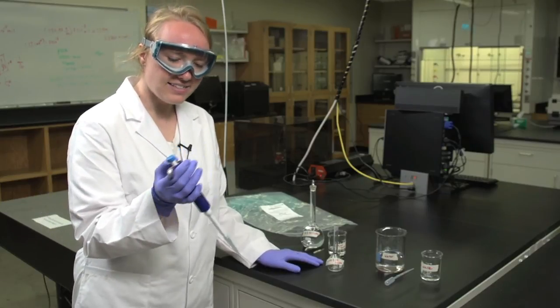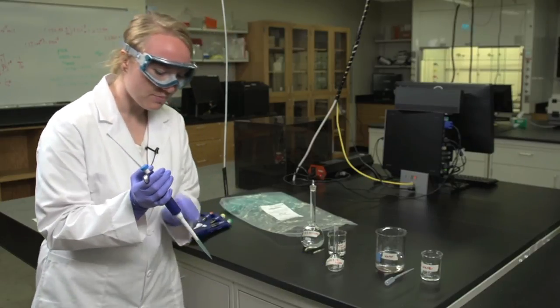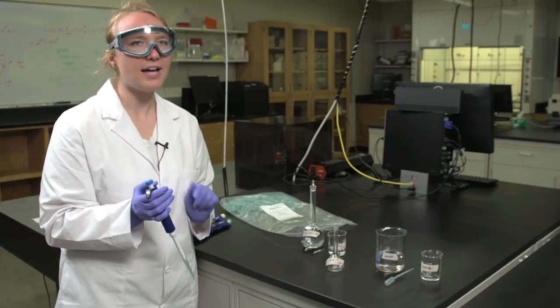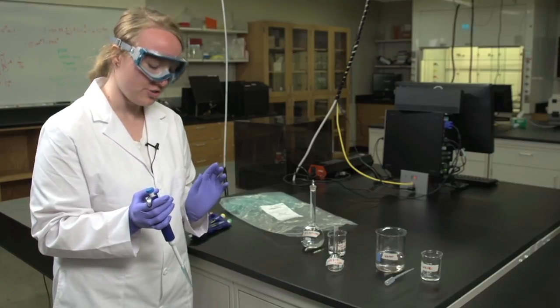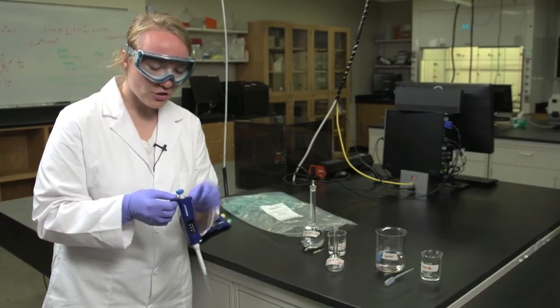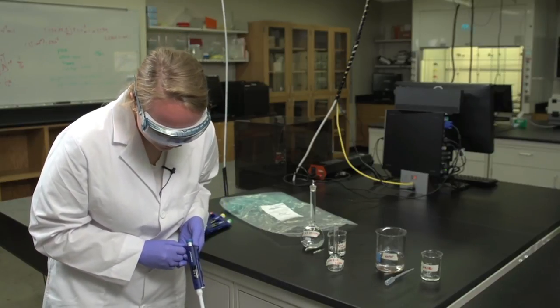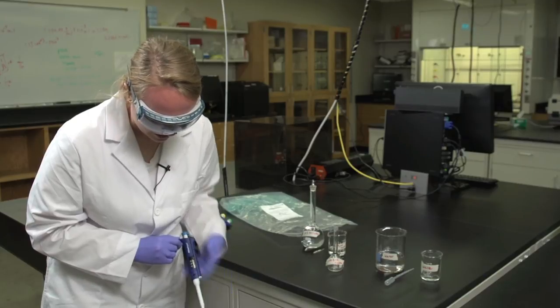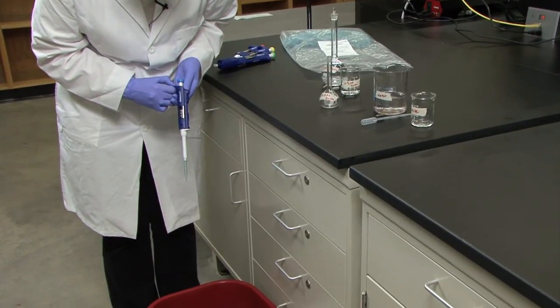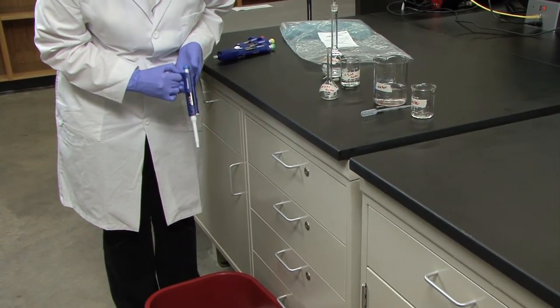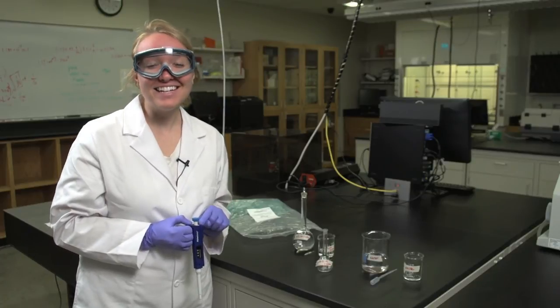The last thing that you need to make sure that you do is throw the pipette tip in the trash, because you cannot use the same pipette tip for more than one transfer. To do that, you are going to want to press down on this button over the trash can, and it will depress and push the tip off. You can just do that and drop it into the trash. And that's it.